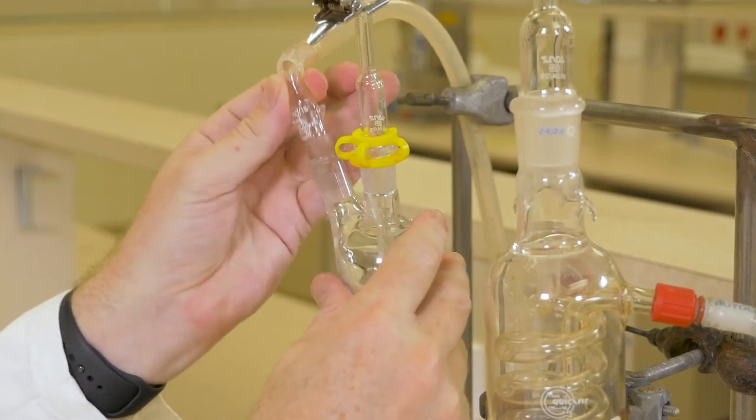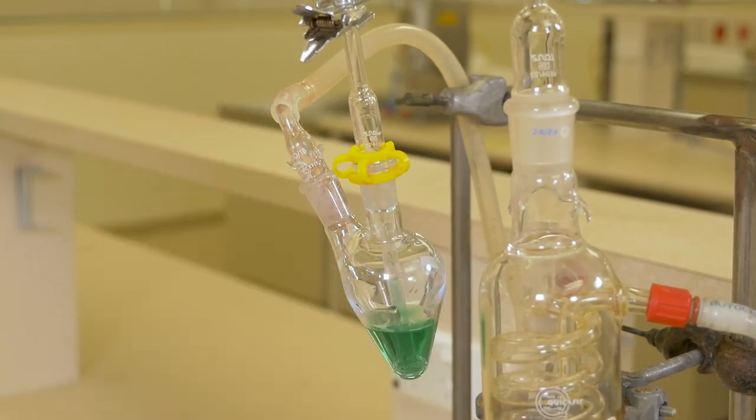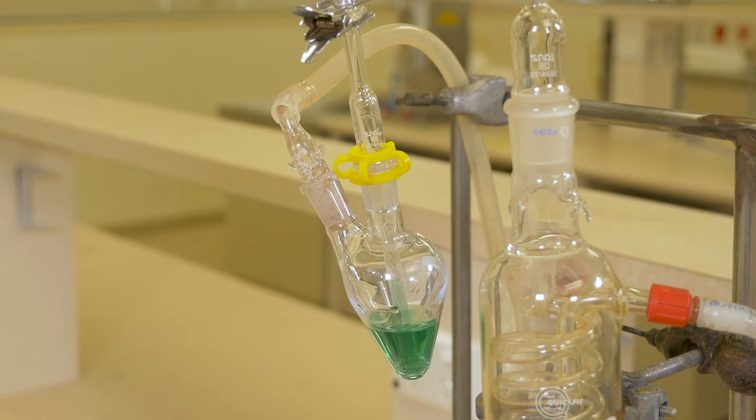The stream of air is introduced by attaching a vacuum pump to the outlet of the pear shaped flask containing the hydrogen peroxide.